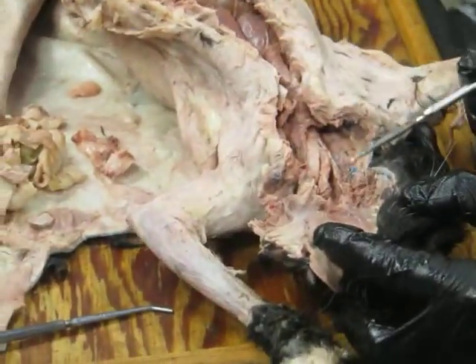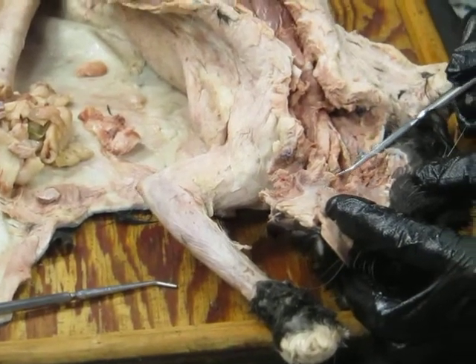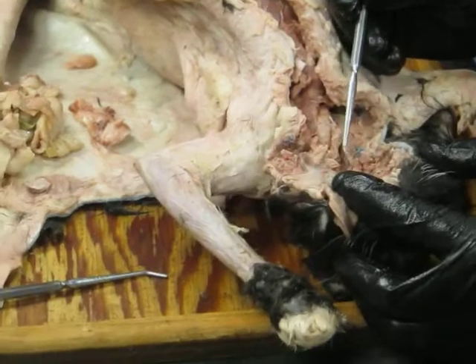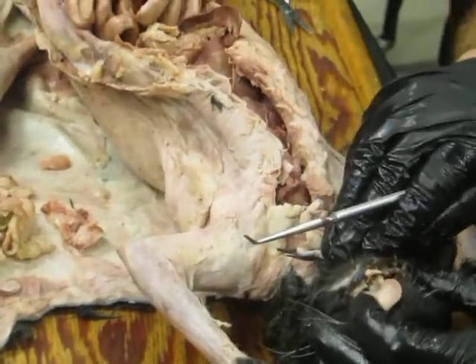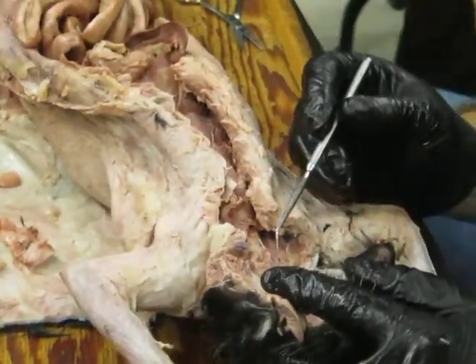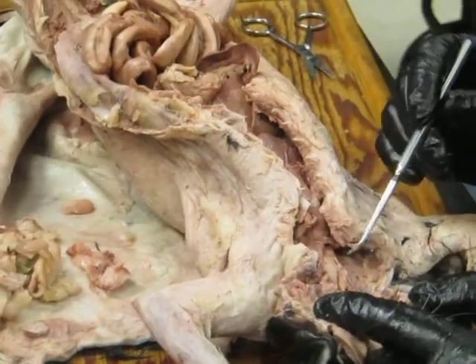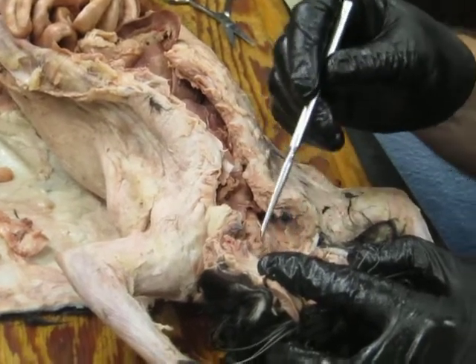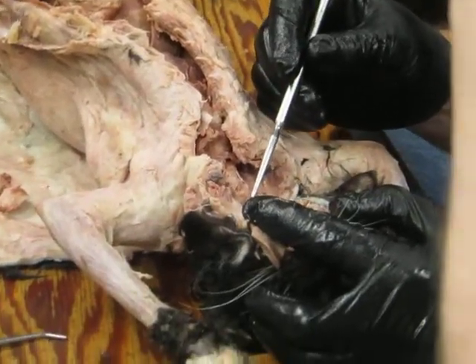You see that? Any guesses? Epiglottis. So this is the epiglottis, which is part of the larynx. And that protects the opening into the airway. And it actually seals very nicely with the back of the soft palate here when the animal's mouth is closed. And so they can basically breathe air in, have it come past the epiglottis and down through the larynx, down the trachea. Food then will come into the oral cavity and pass around the epiglottis to either side and extend dorsally into the esophagus.